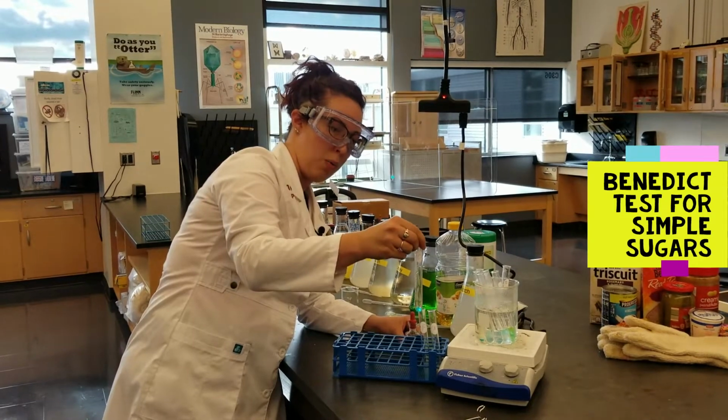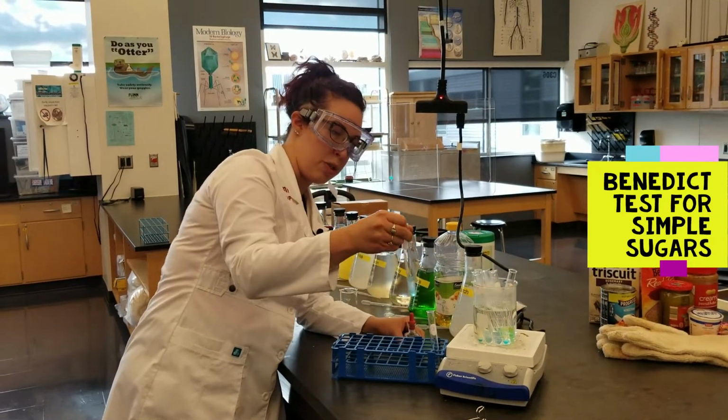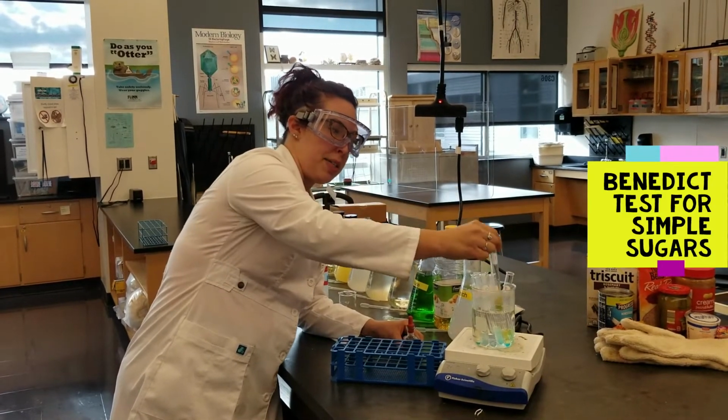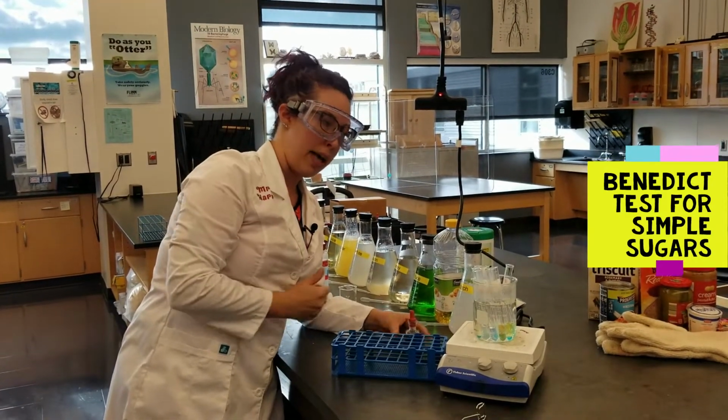It takes a couple of minutes for this to incubate, usually around 3 or 4 minutes. So we'll come back and check the results momentarily.